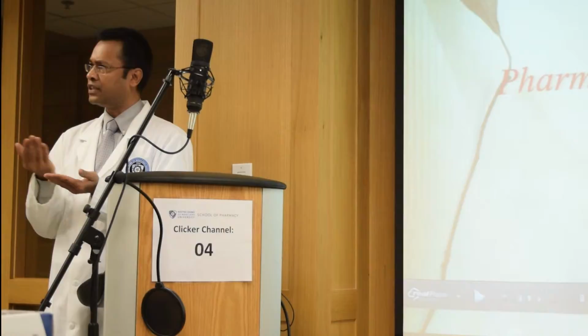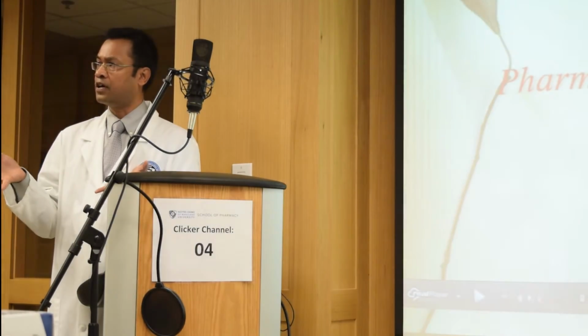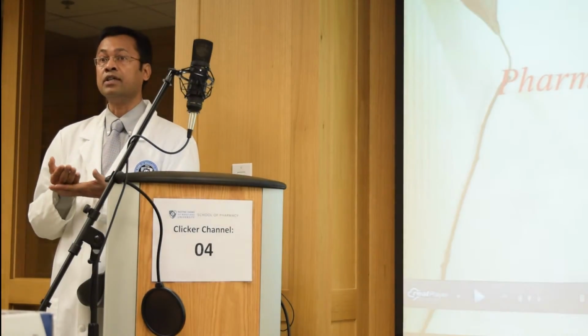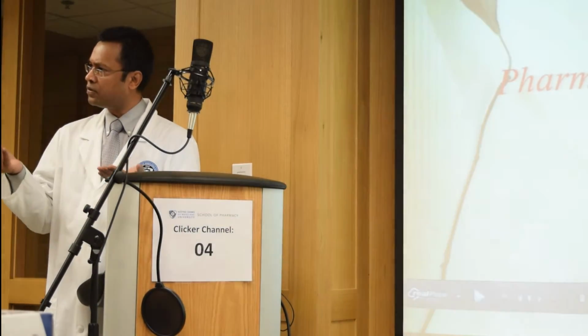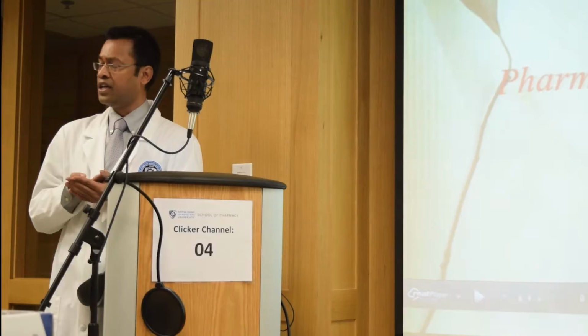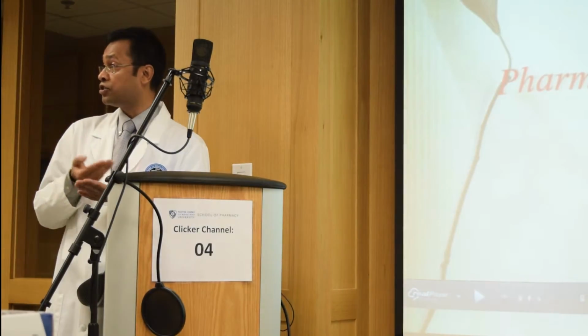The various types of delivery systems and dosage forms that we compound in the pharmaceutics lab are tablets, capsules, ointments, creams, pastes, and emulsions. At the same time, there are other release profiles of dosage forms available in order to extend the release of a drug product, to do targeted release, or controlled release.